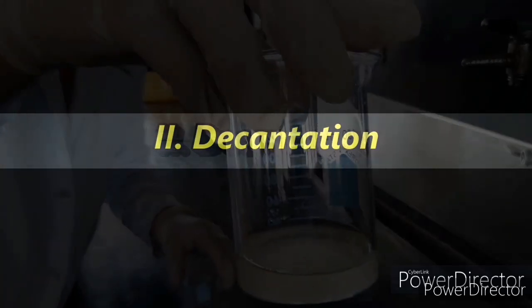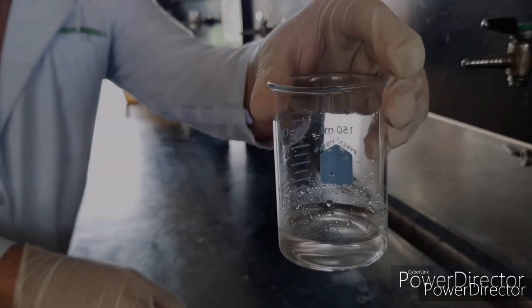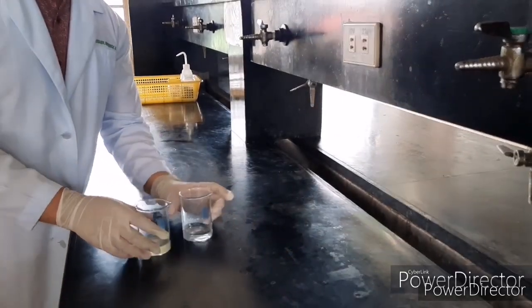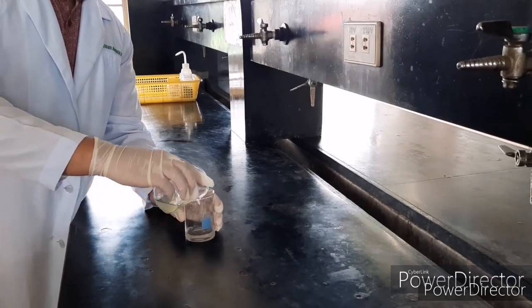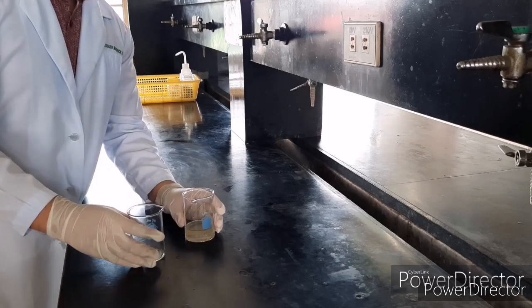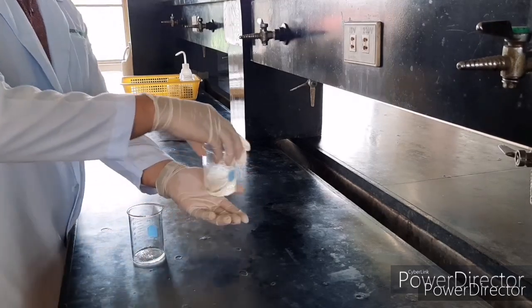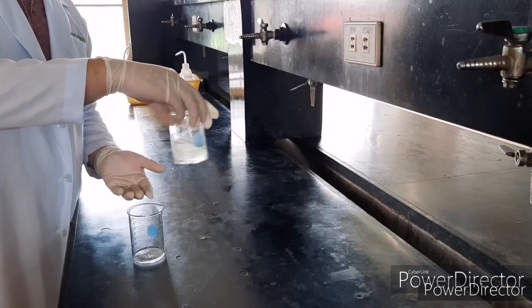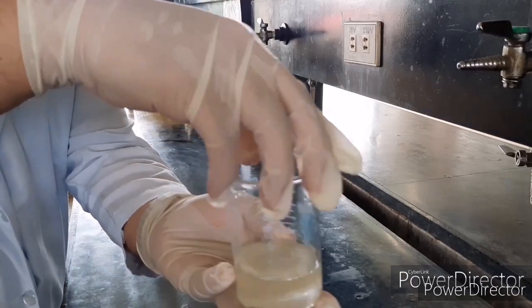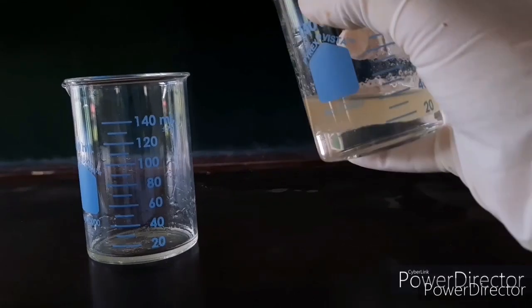Procedure 2. Decantation. We will still be using the same components of our mixture. We have the water and the oil. So first we have to mix them together. After mixing, let it stay for a while and let them separate completely from each other.